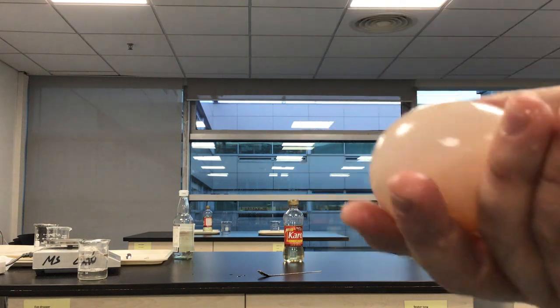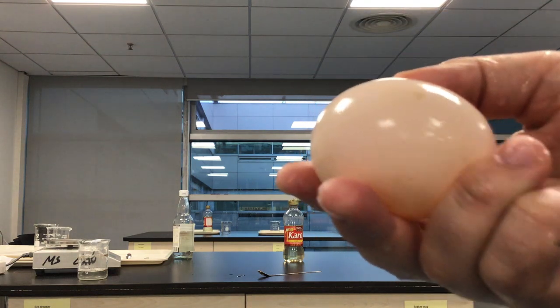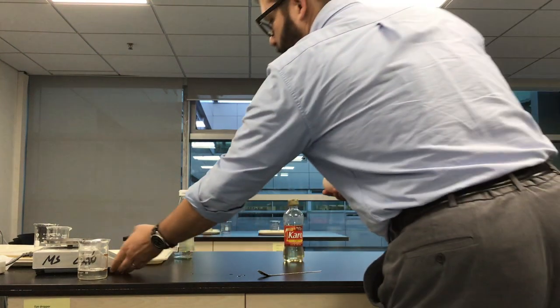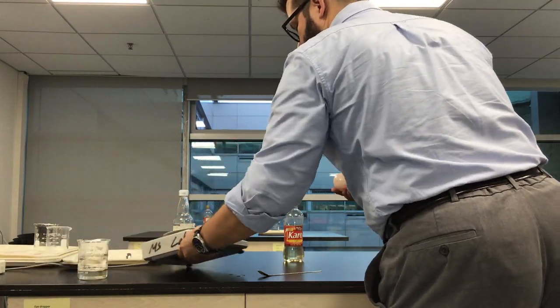The next thing you're going to do is take some quantitative observations of this. Go over to your electronic balance.